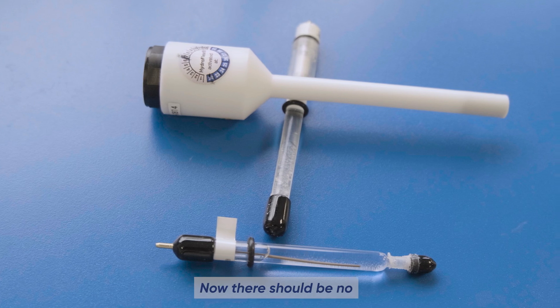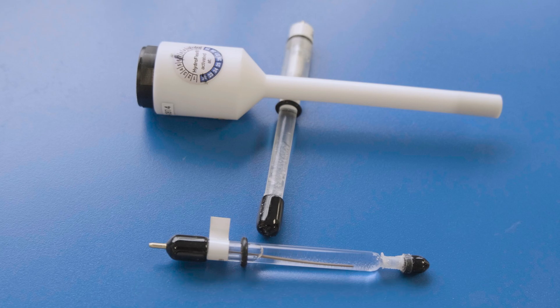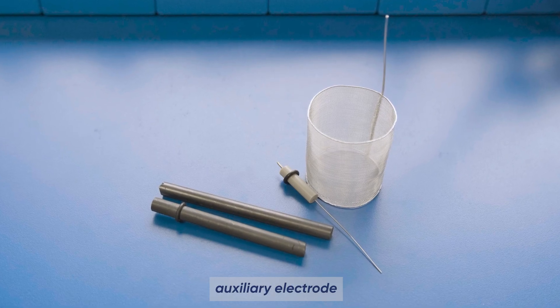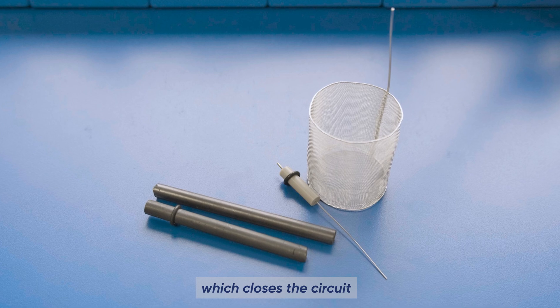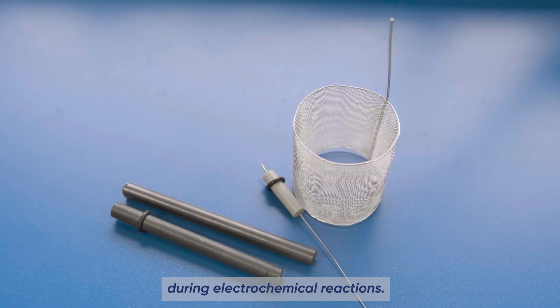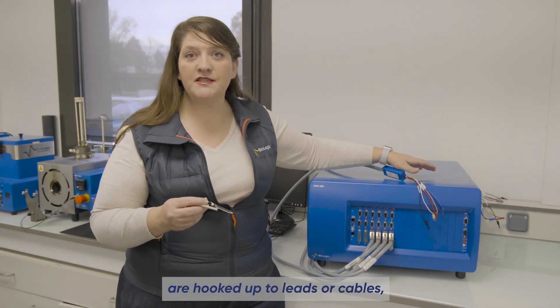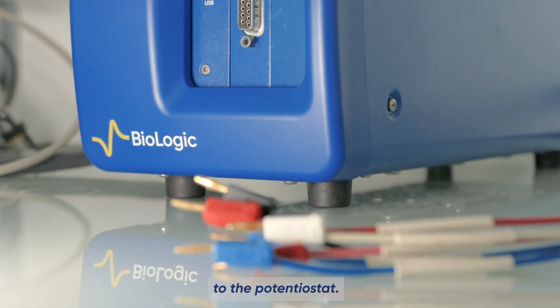There should be no electrochemical reactions occurring at the reference electrode. And finally, the counter or auxiliary electrode, which closes the circuit and allows the current to flow between it and the working electrode during the electrochemical reaction. These electrodes are then hooked up to leads or cables which are connected to the potentiostat.